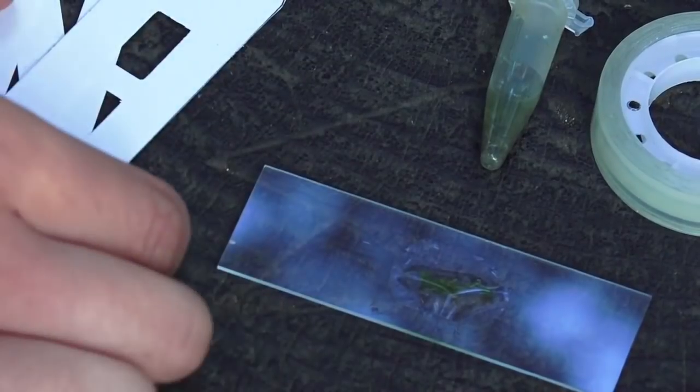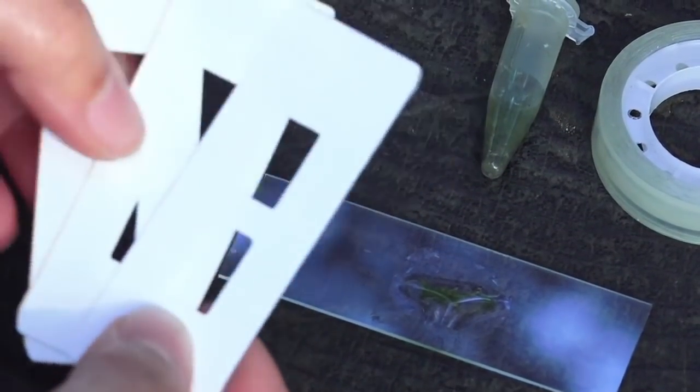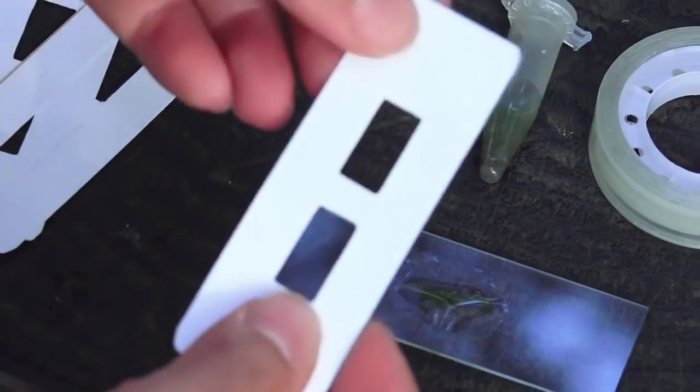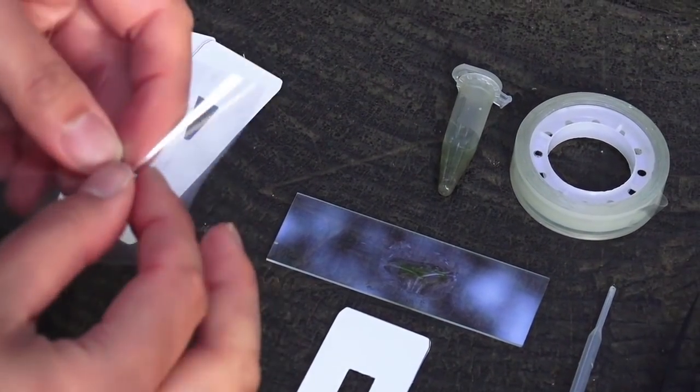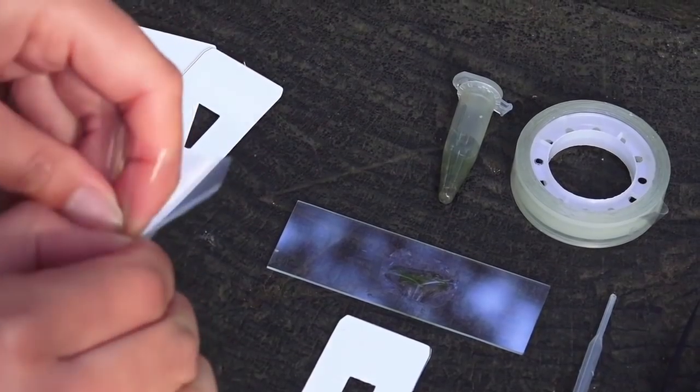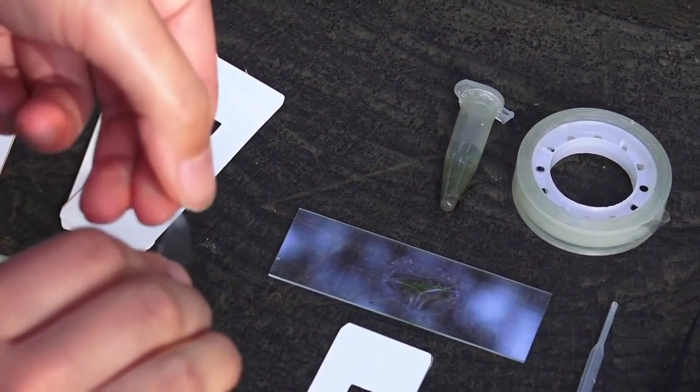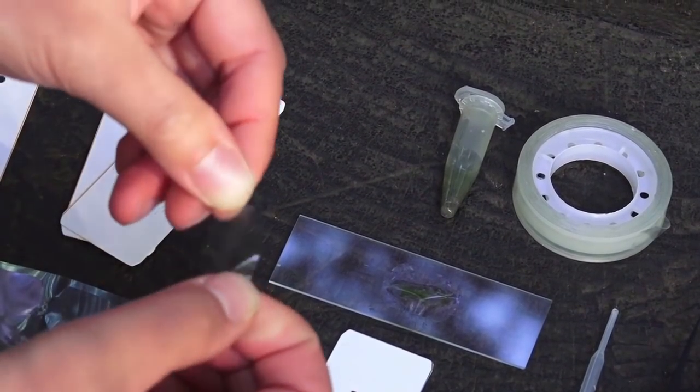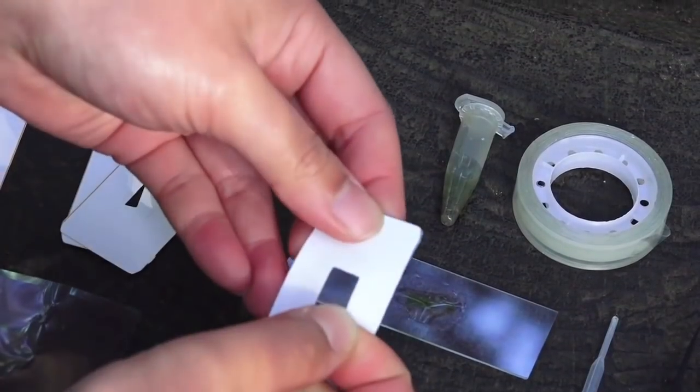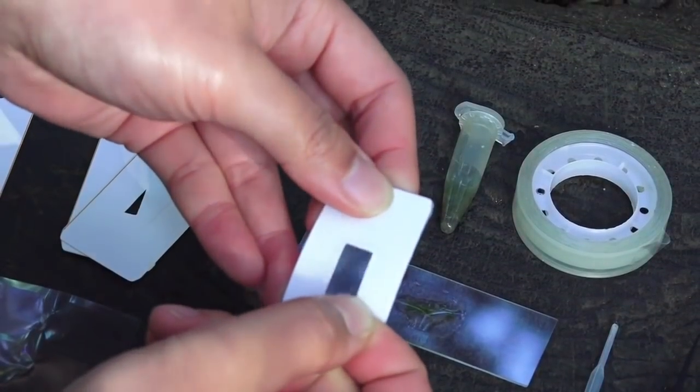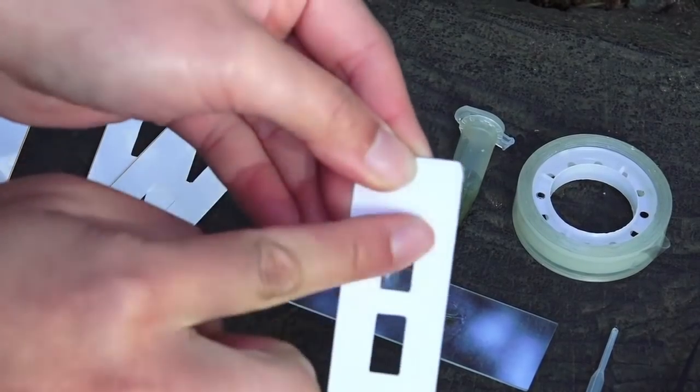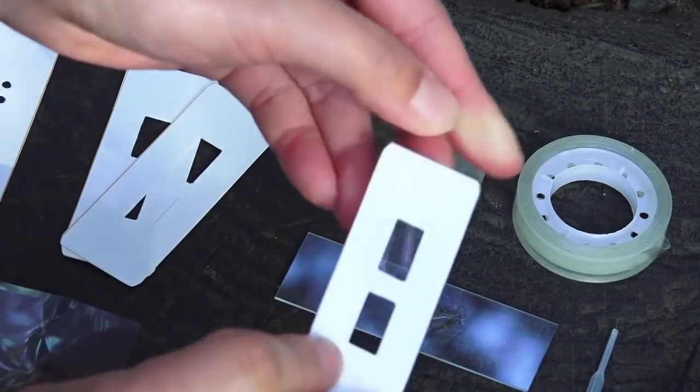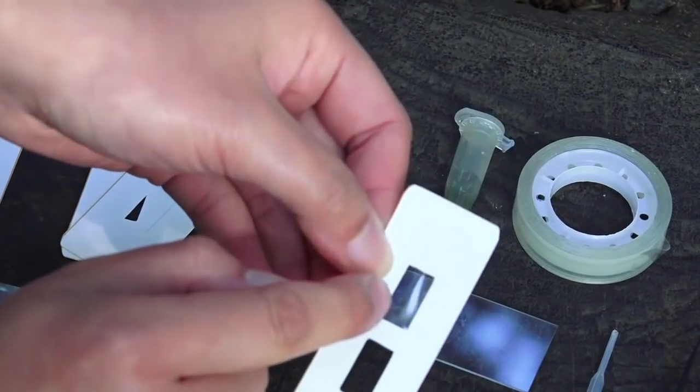If you're using paper slides, you're going to take one paper slide, put one sticker on this side, make sure you're attaching it and then flip it over so that this side is sticky.